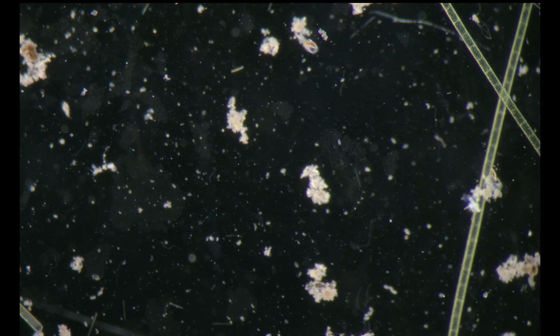Okay, I don't see anything interesting in here, so I'll suck the sample. Using the same dish, I'll take from another part of the sample. I think this one has some more potential.